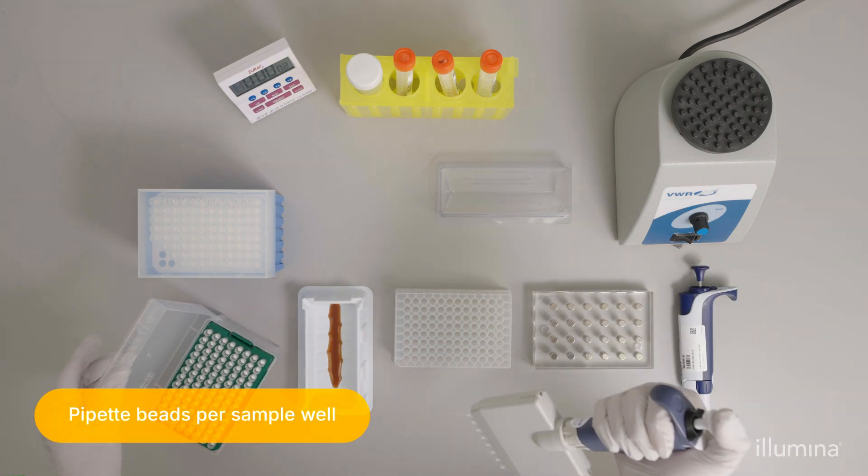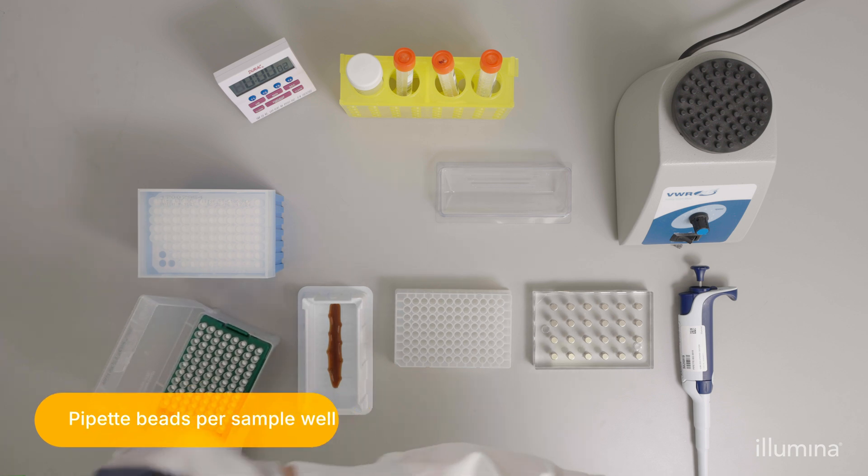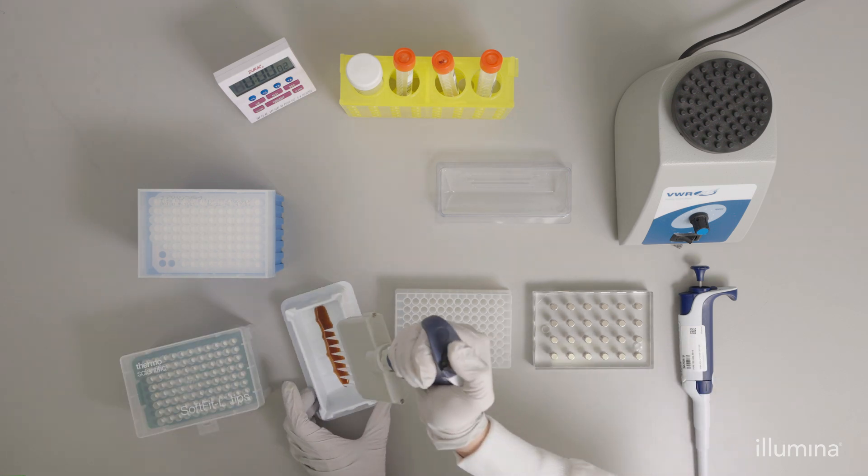Transfer appropriate volume of SPB beads per well from the trough to a new 96-well MIDI plate using a 200 microliter multi-channel pipette.